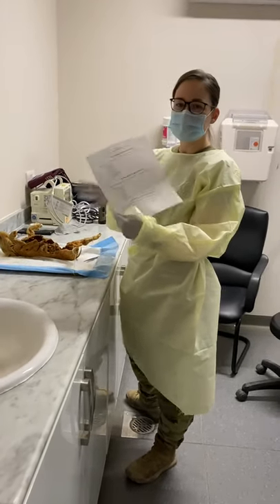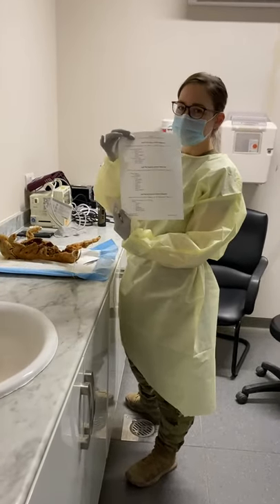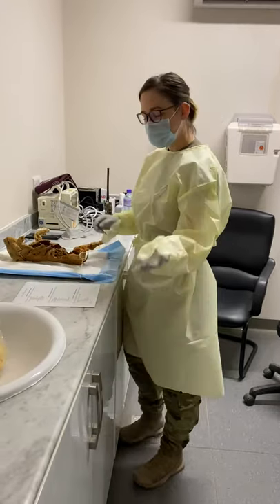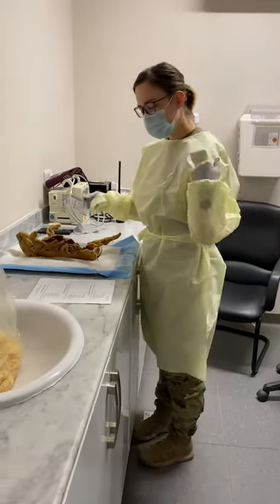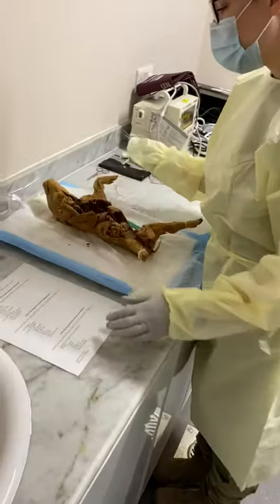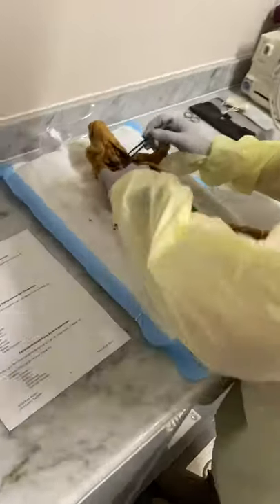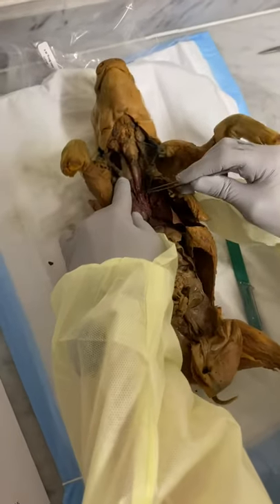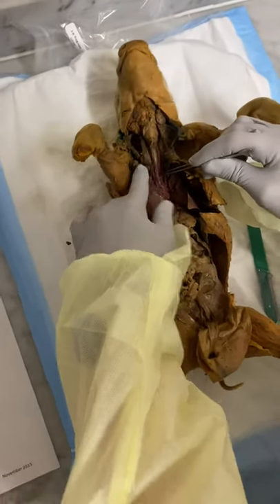I have my sheet, there's no additional information on it. So I'm just going to come over here and then we'll just start with the esophagus of my fetal pig, which is just right here, my esophagus.